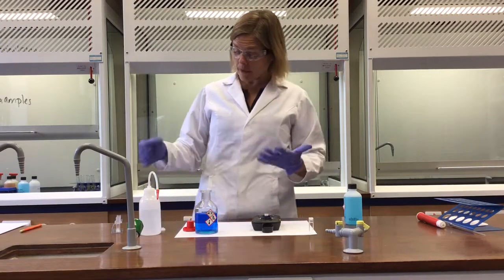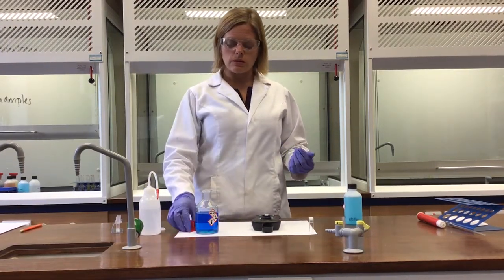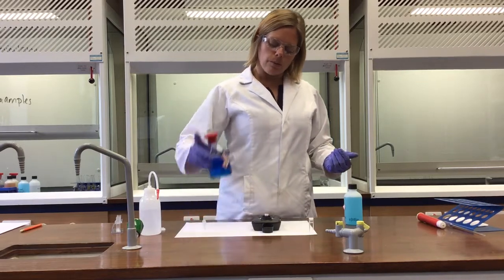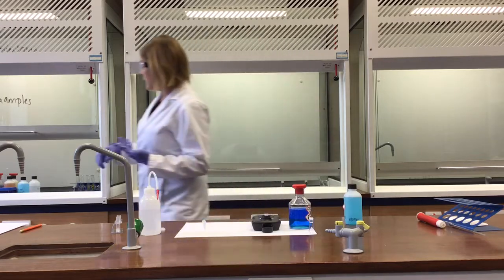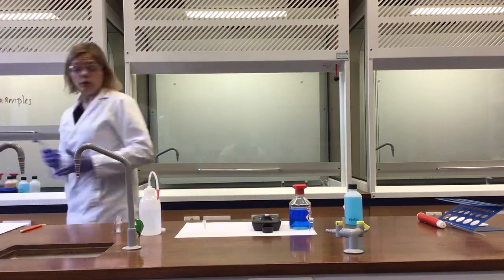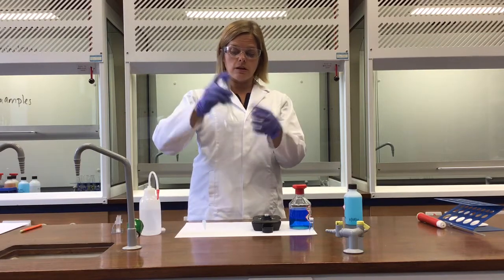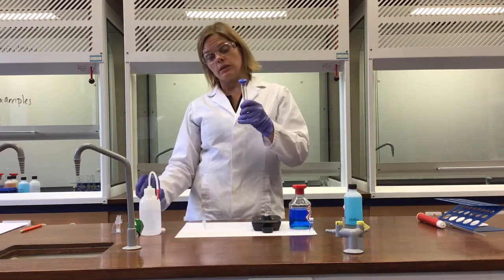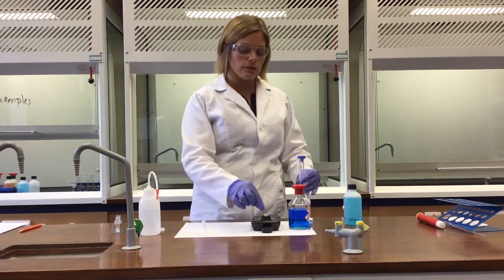And I can keep going and, as I say, measure the various concentrations in between the two. So in a few moments I will make up some known concentrations of that copper sulfate, for instance by taking a volume of the 1 molar and diluting it up to 100 centimetres cubed, testing that one, diluting again quantitatively, testing that one, and so on, so that I've got a good range of values.